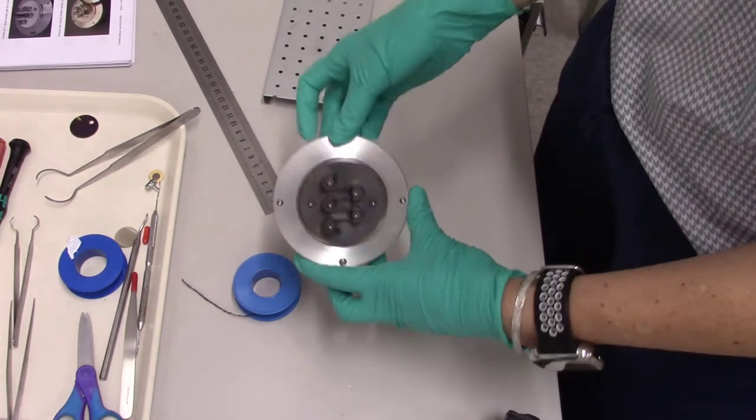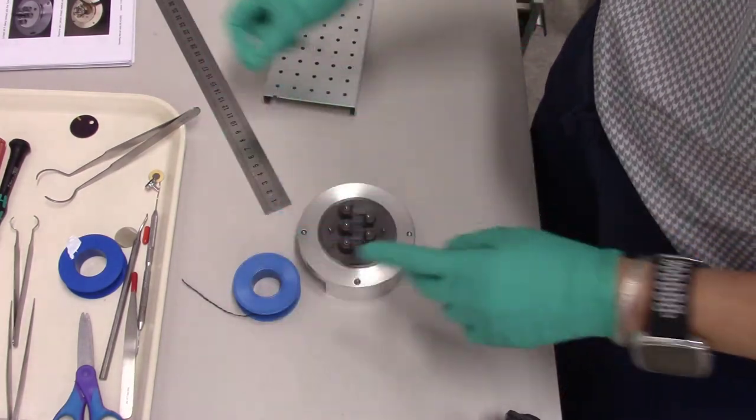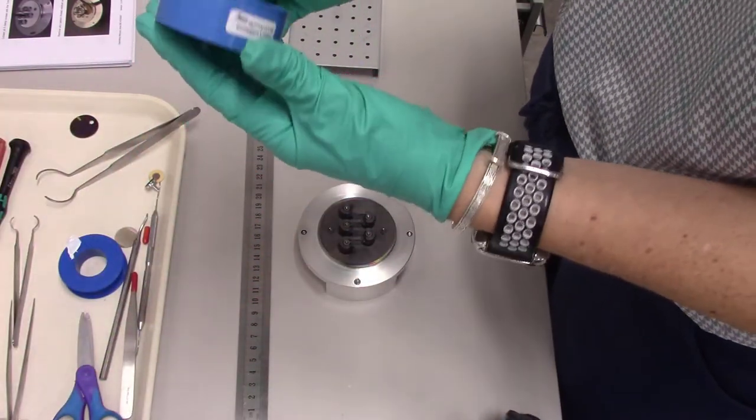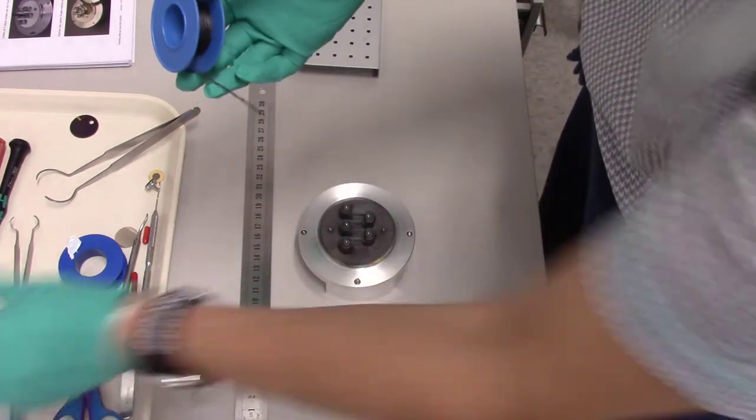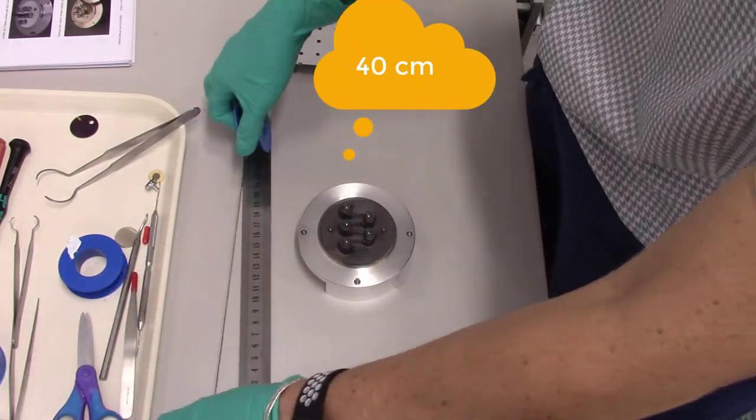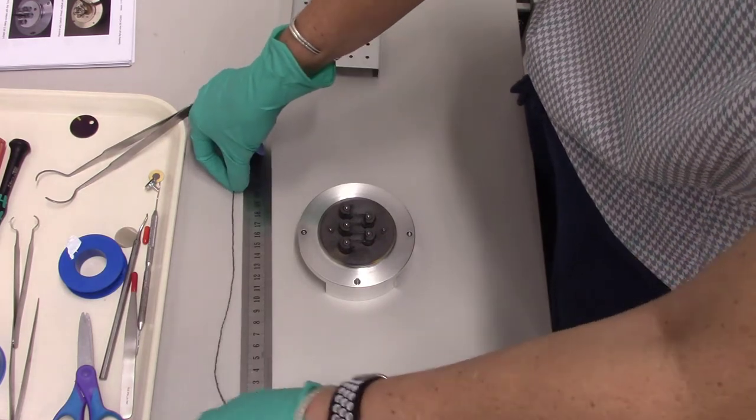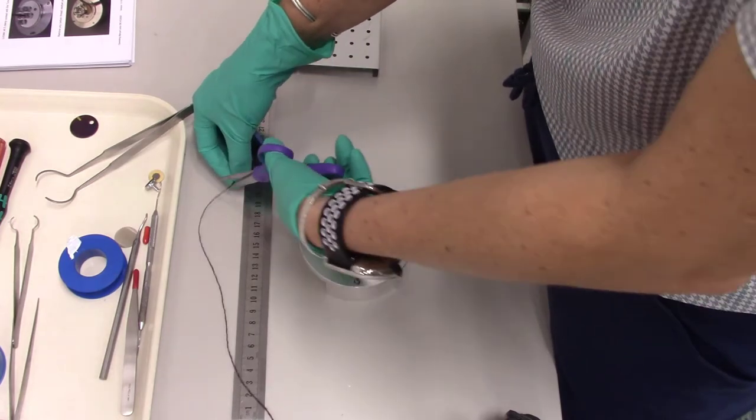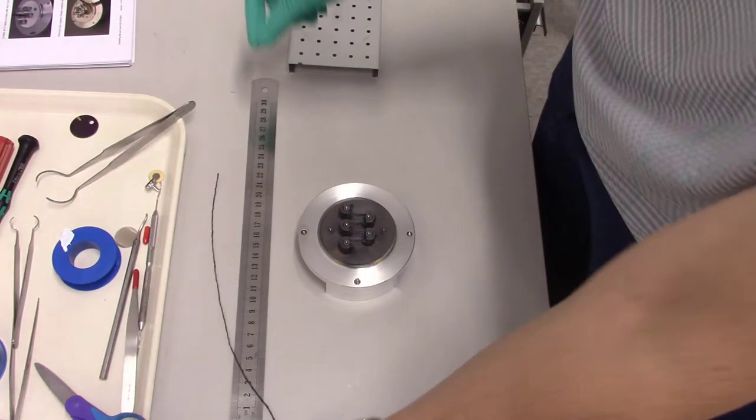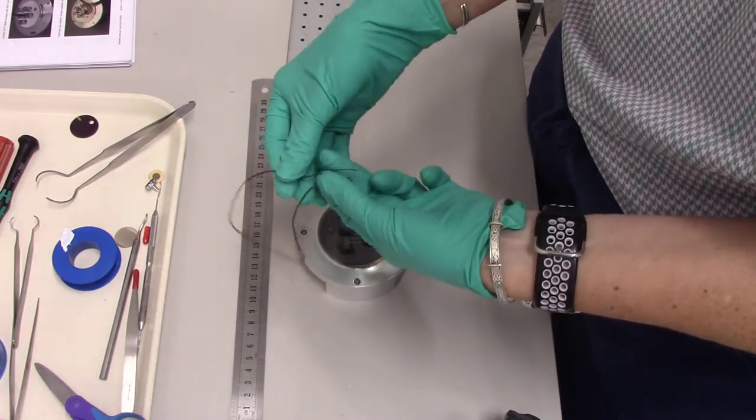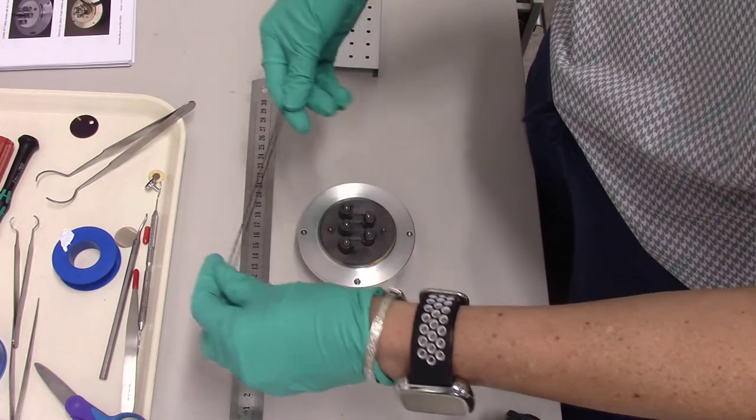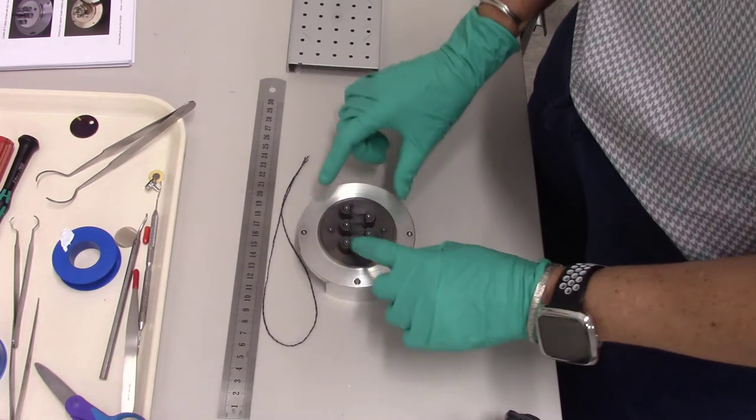I'm going to do a double threaded setup so I can get two carbon coats out of it. I'm going to measure, so this is the carbon thread that should be sitting right here. It comes in a little blue packet like this. I'm going to open this up. I'm going to measure 40 centimeters. So it is actually pretty exact. So I'm going to take this and cut 40 centimeters with little scissors, wearing gloves. I'm going to double this thread. So I'm going to put the two ends together, and then I'm going to use this to replace the threads on here.